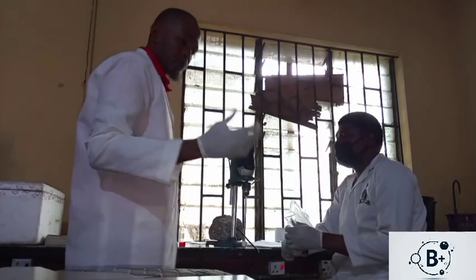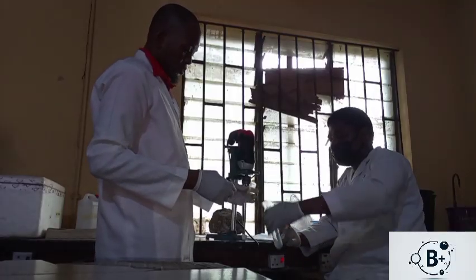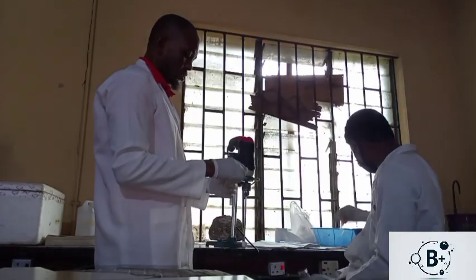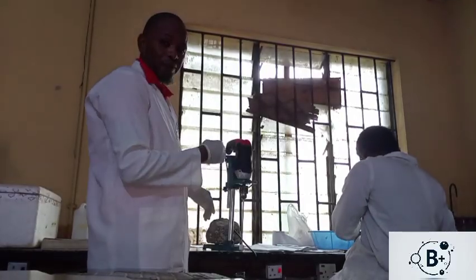So you can run the homogenizing machine for 15 seconds at intervals. Then at some point when you're changing a group, you can leave it for 20 minutes just to help the machine efficiency.